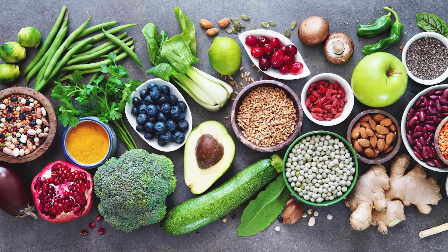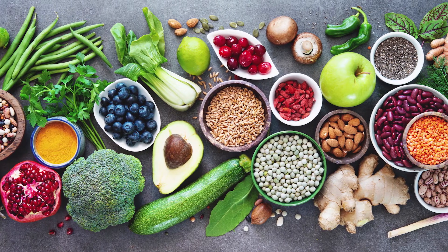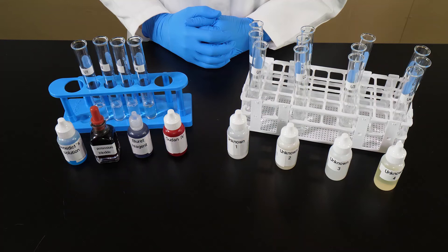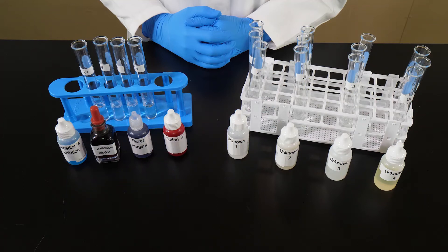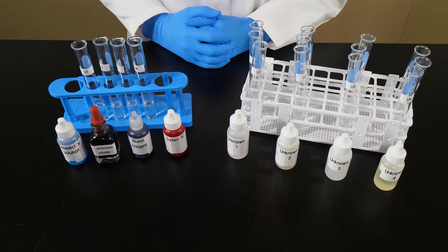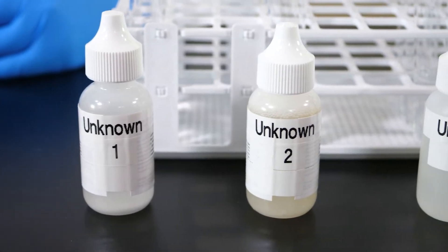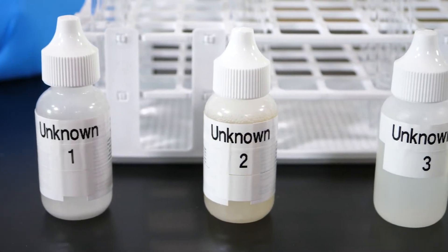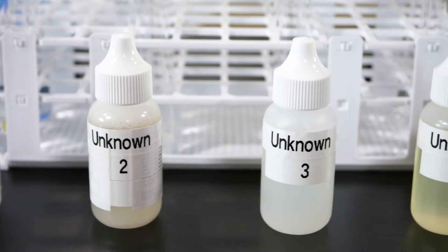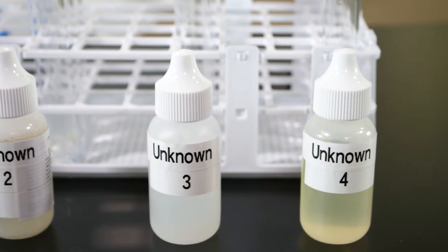We cannot always look at a food source and tell what nutrients it contains. However, there are certain tests a researcher can perform to determine what nutrients are present in food. During this lab, we will be testing four unknown solutions to determine what nutrients are present in each solution.